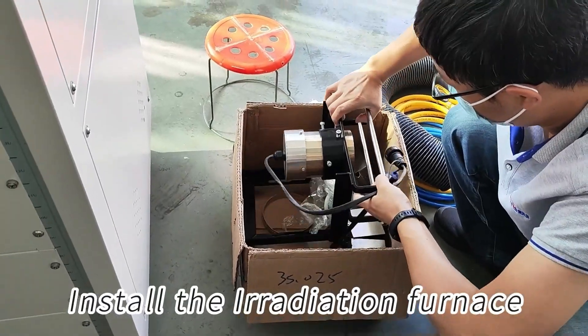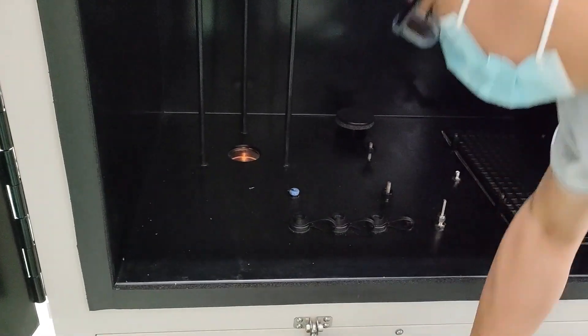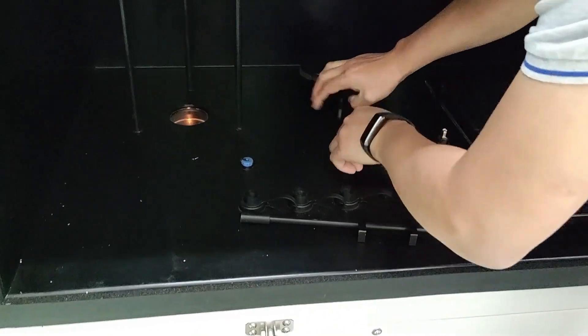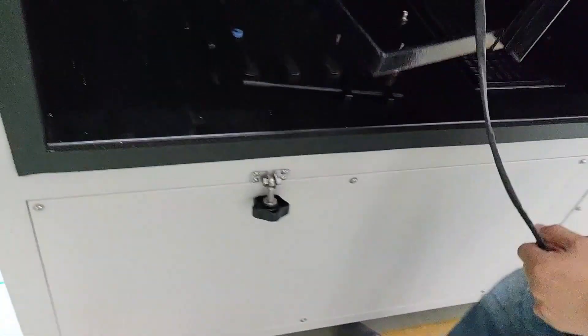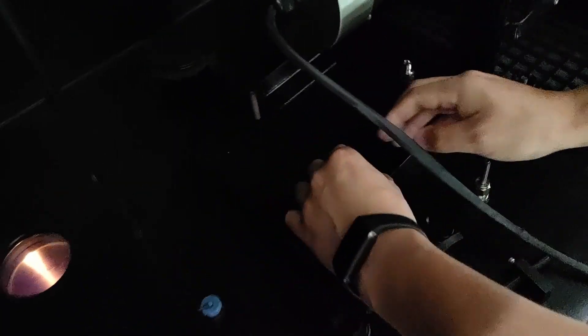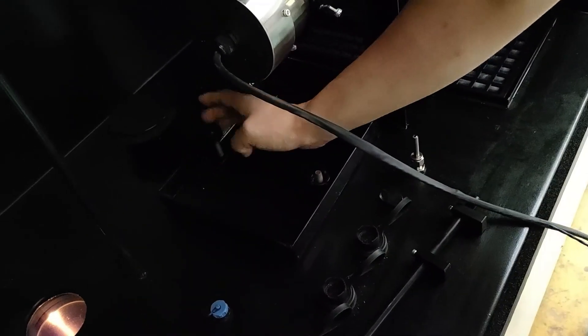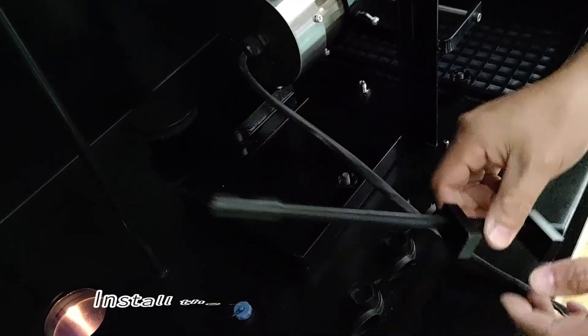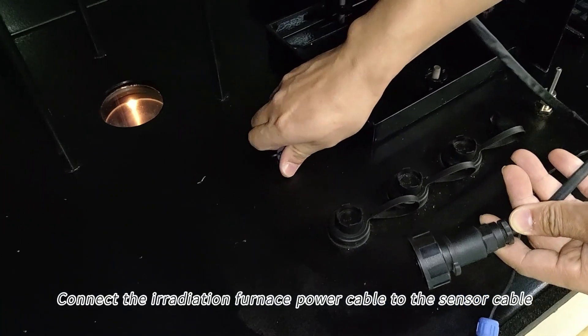Install the irradiation furnace and the irradiation furnace rod. Connect the irradiation furnace power cable to the sensor cable.